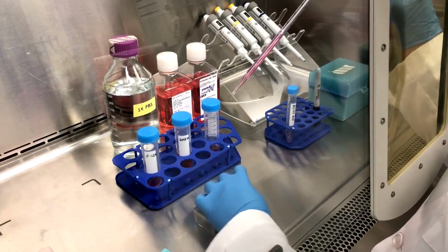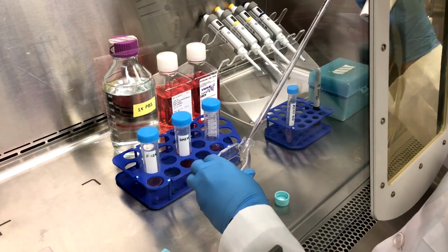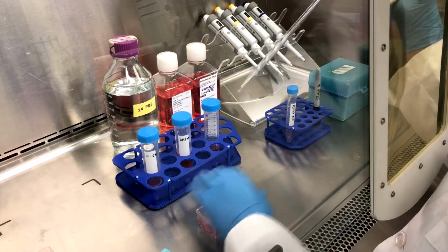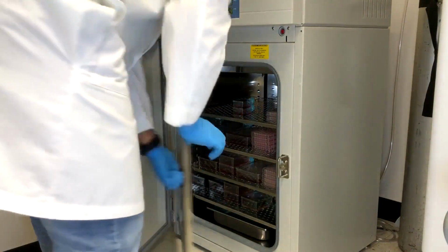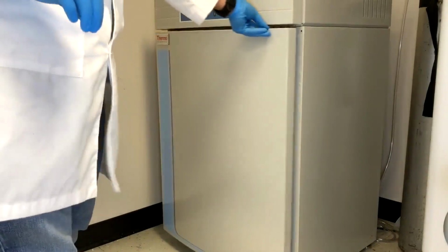First, seed the culture cells in an appropriate flask sufficient for RNA and protein extraction to perform gene expression using qPCR or microarray analysis. Then incubate overnight with media supplemented with 10% FBS and 1% penicillin streptomycin.